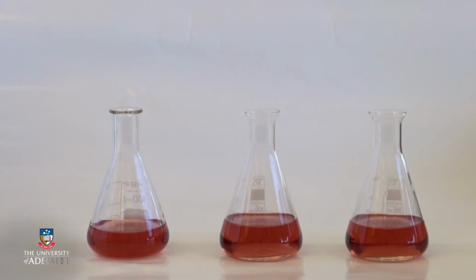This simple demonstration highlights the effects of pH and bisulfite on wine colour, as mentioned in the video on wine chemistry. The reactions you'll see are from the red grape anthocyanins, which give red wine its colour. Anthocyanins themselves are unstable, but are incorporated into derived pigments that provide long-term wine colour.